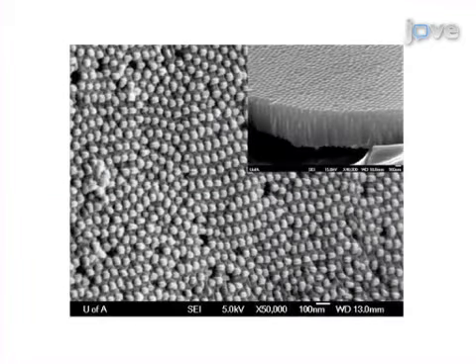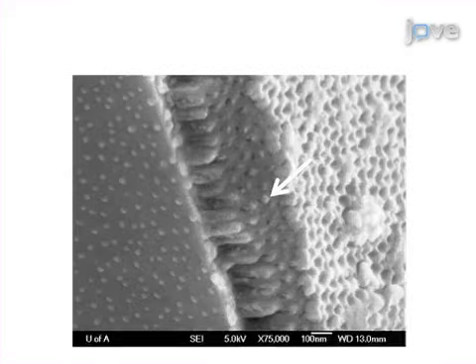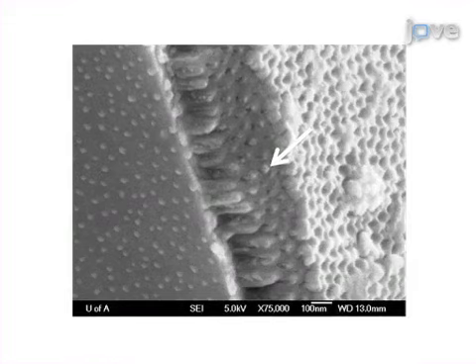Ultimately, scanning electron microscopy is used to show the existence of organic nanowires within the pores of the anodic aluminum oxide template.